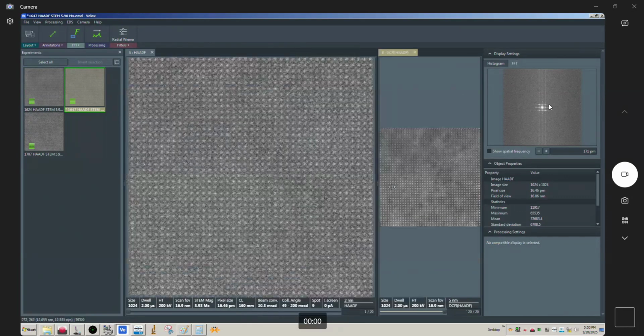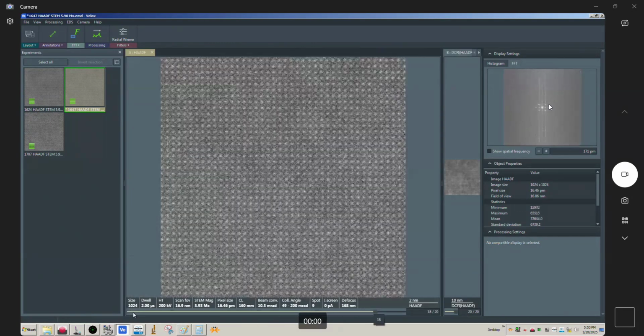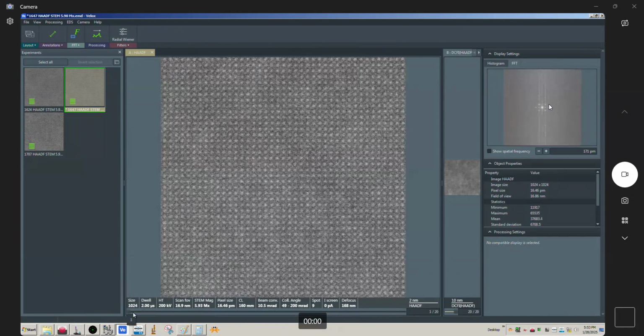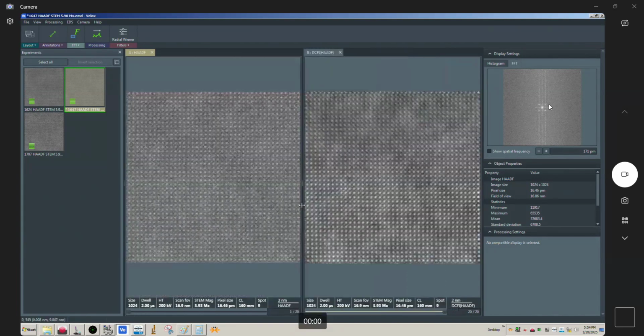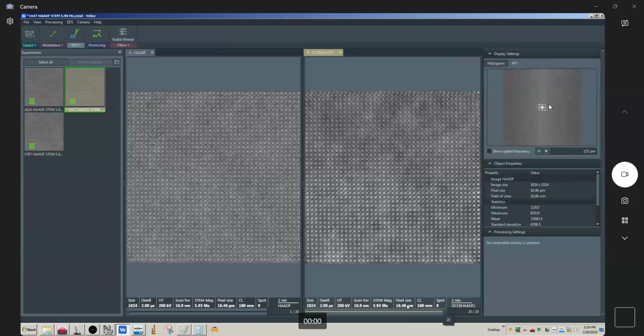And again, if we look at what's happening at the individual frame level here, you can see that's very chaotic movement going on, right? From frame to frame, okay? And so that's going to make it hard for the summation to be accurate when it's drifting in a manner like that, in a manner that's chaotic, in a manner that's not constant, okay? Doing the overlay or the addition of each frame subsequently is not going to be accurate, okay? And we can see that here very clearly, right? One frame looks fine, right? Because it's just one frame. And so 2 frames, so 3, now it's 4, it's starting to look a little iffy. Yeah, by 6, you can see clearly it's not working very well, okay? And so not good, right?